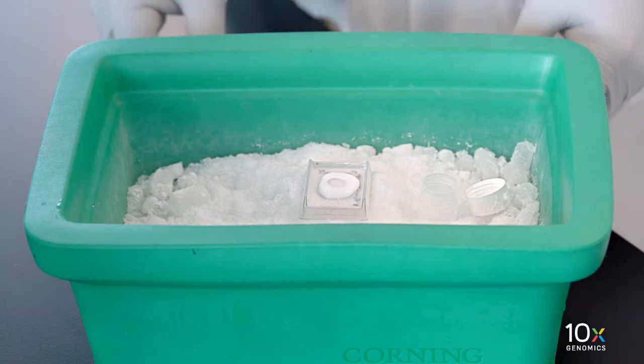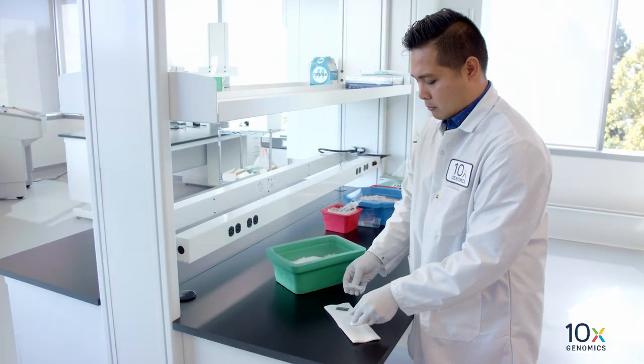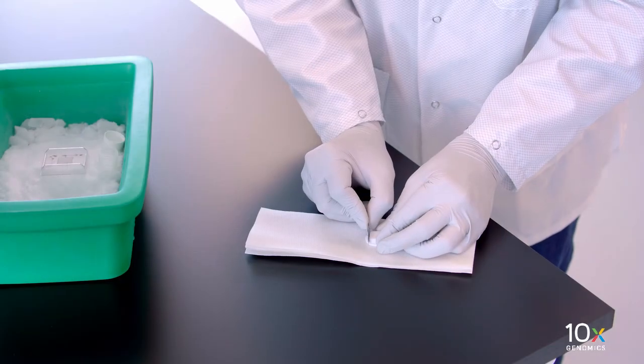Once the OCT is completely frozen, remove the tissue block from the cryo mold and trim it using a razor blade.